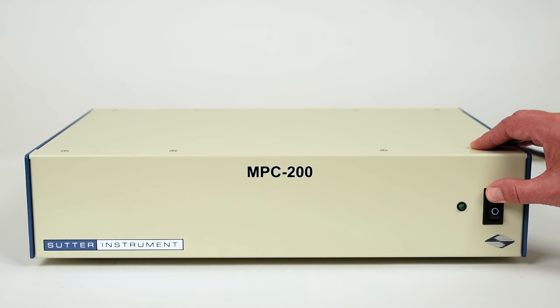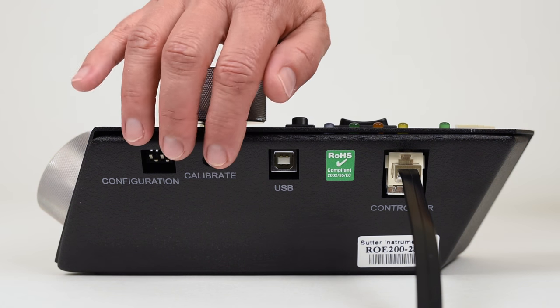Turn the controller back on and run the calibration.